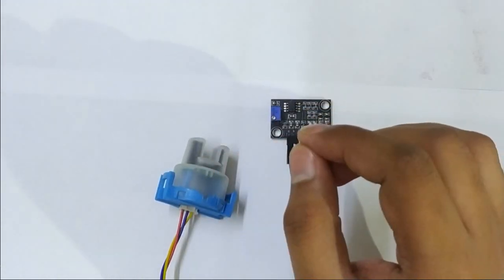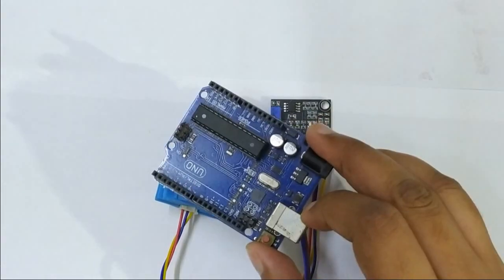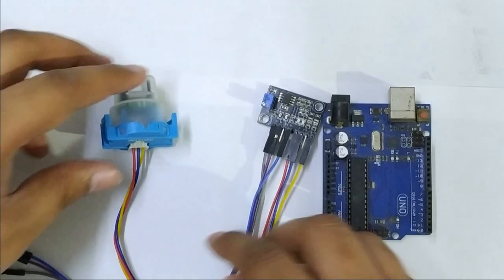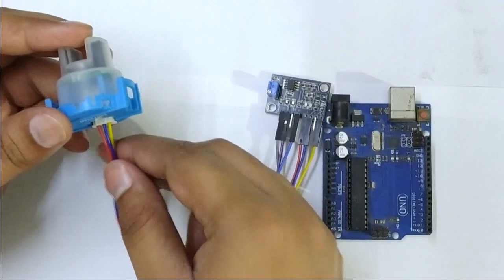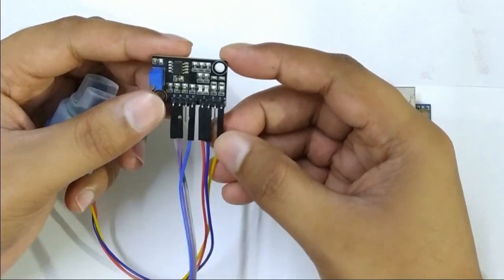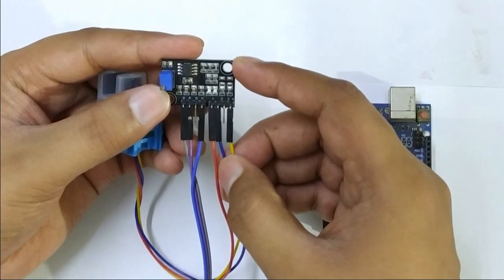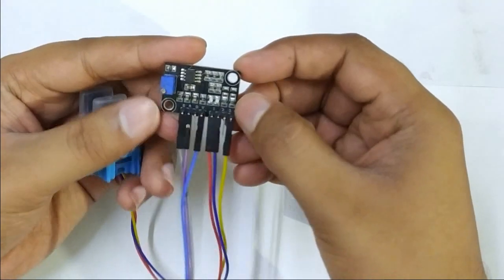So let me just show you how we can interface it with the Arduino. I am going to use the Arduino Uno. Here, as you can see, there are three wires connected to the turbidity sensor, with the colors yellow, blue and red. The yellow wire is connected to the third pin of the power circuit of the amplifier circuit, the blue wire is connected to the second pin, and the red wire is connected to the first pin of the amplifier circuit.